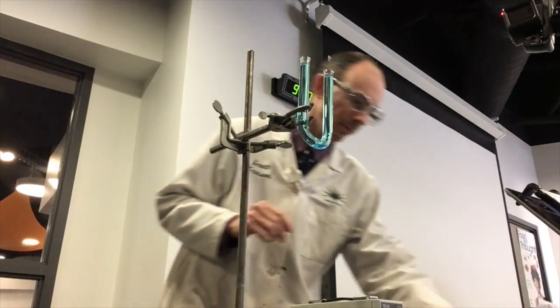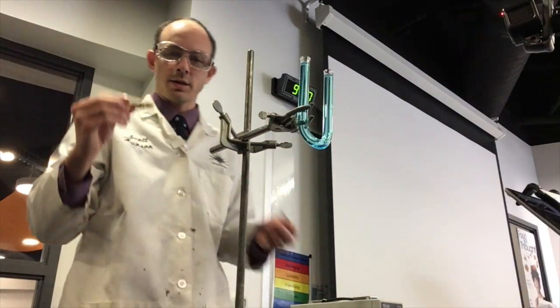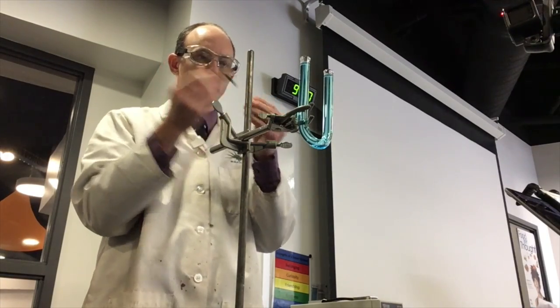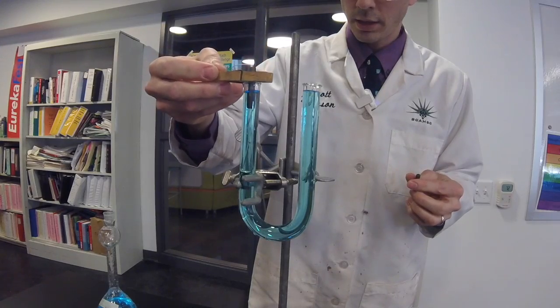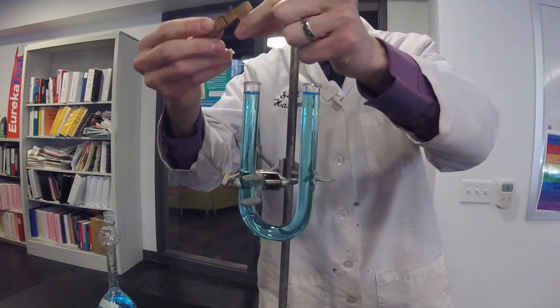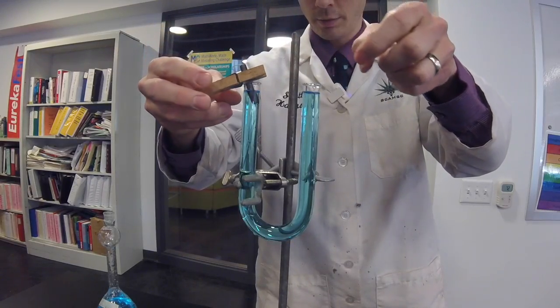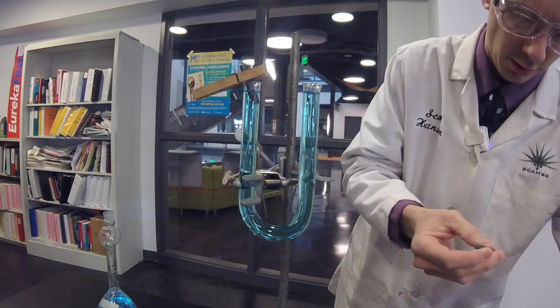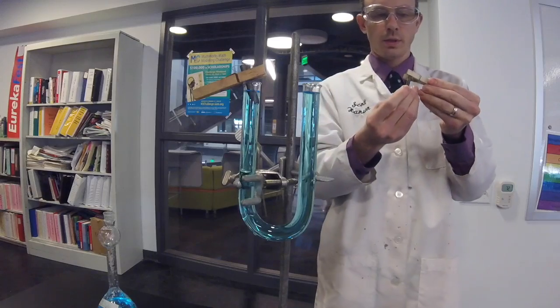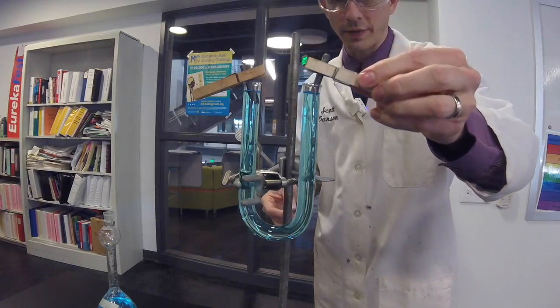Alright, then I'm going to take these clips and put them with a little bit of a pole on the top.